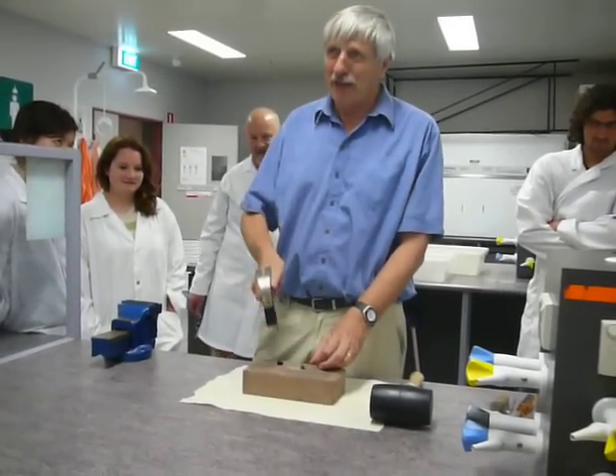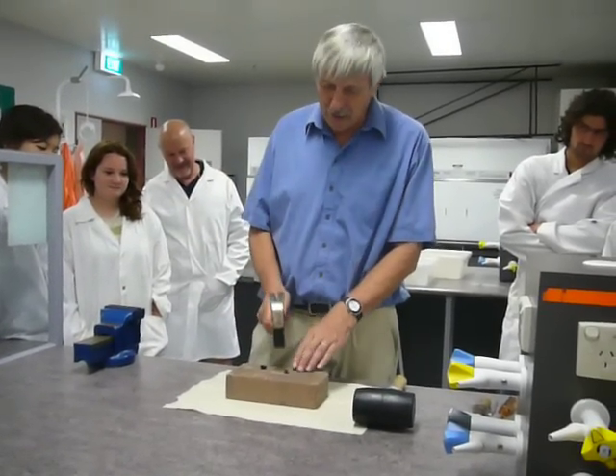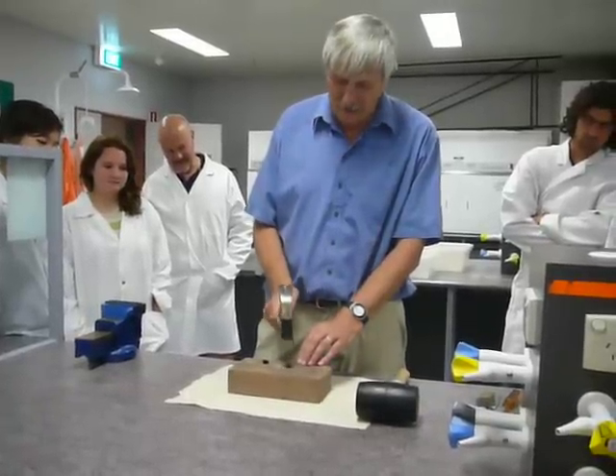You don't get a bloody great thumb because all you do is completely squash it. The whole idea is just to crack the shell gently and you just tap it a little bit harder each time, and so it's actually — you can hear it crack.